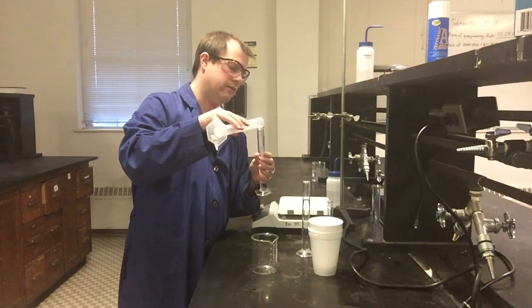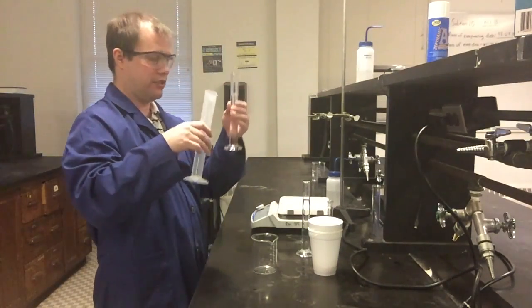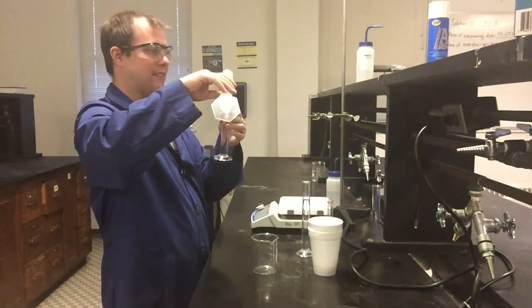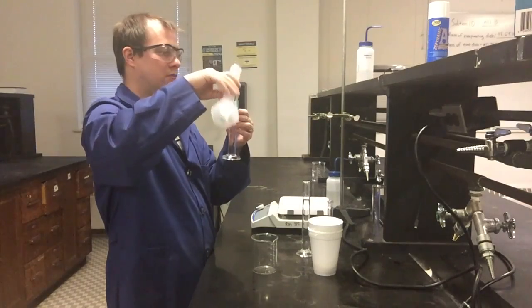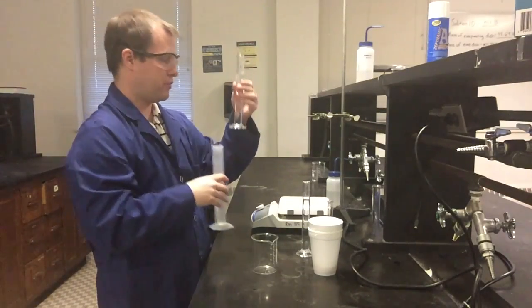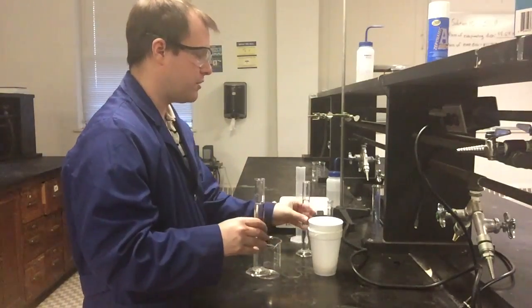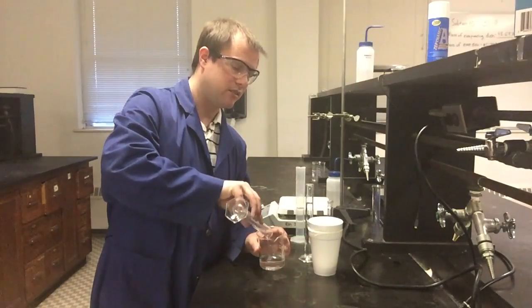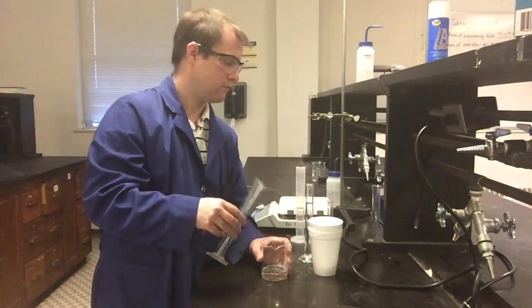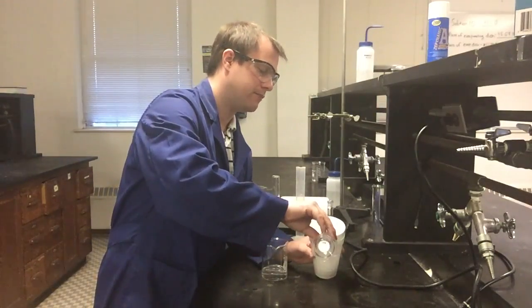And in this case, I'm going to go ahead and put the sodium hydroxide into the beaker and the acid into the styrofoam cup. But which one goes where really doesn't make any difference. That should be pretty close, about 49, maybe 0.90. And so what I'm going to do now is add, like I said, sodium hydroxide, so my base, to my beaker. I'm going to add my acid to the styrofoam cup.